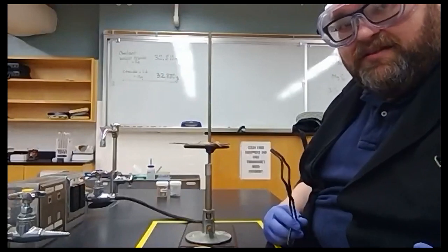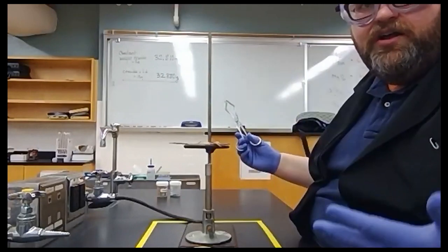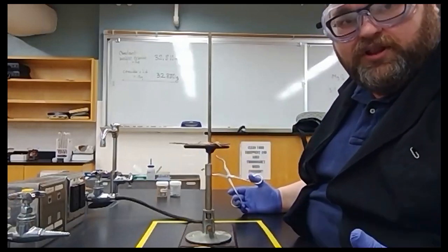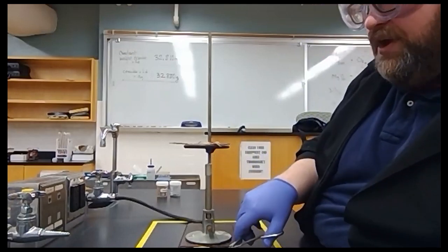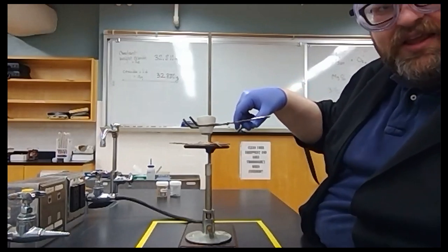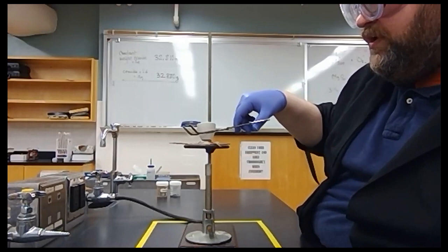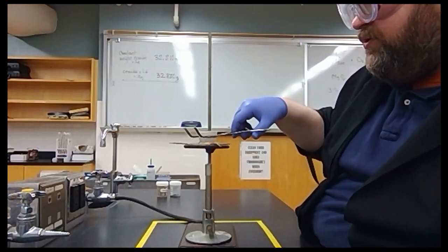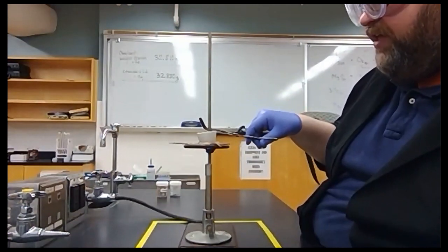We need that magnesium to ignite in the presence of oxygen. So we have oxygen all around us, more oxygen than we'll ever use for this experiment. So we have a whole lot, we have an excess reagent of oxygen. We're going to take this magnesium ribbon in the crucible. We're going to gently, again, temper it. We're going to heat it gently, and then slowly put it back into that hottest part of the flame.